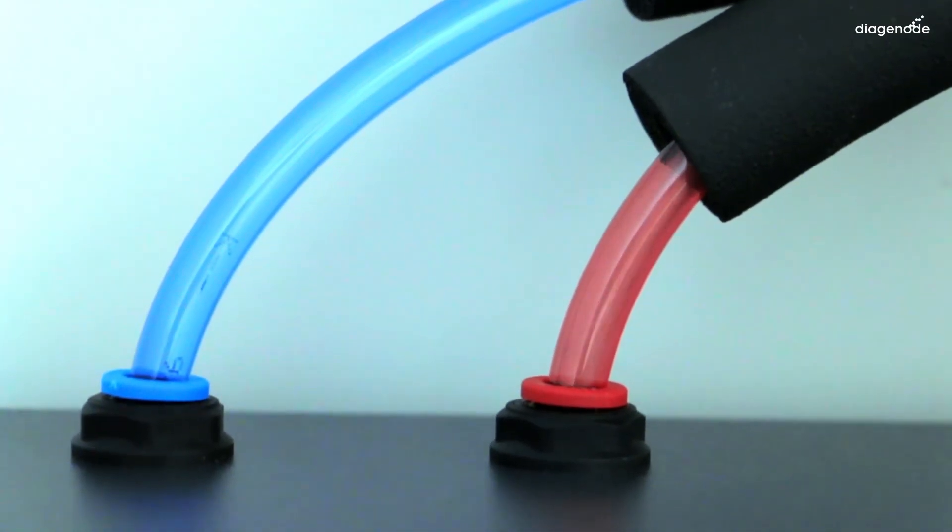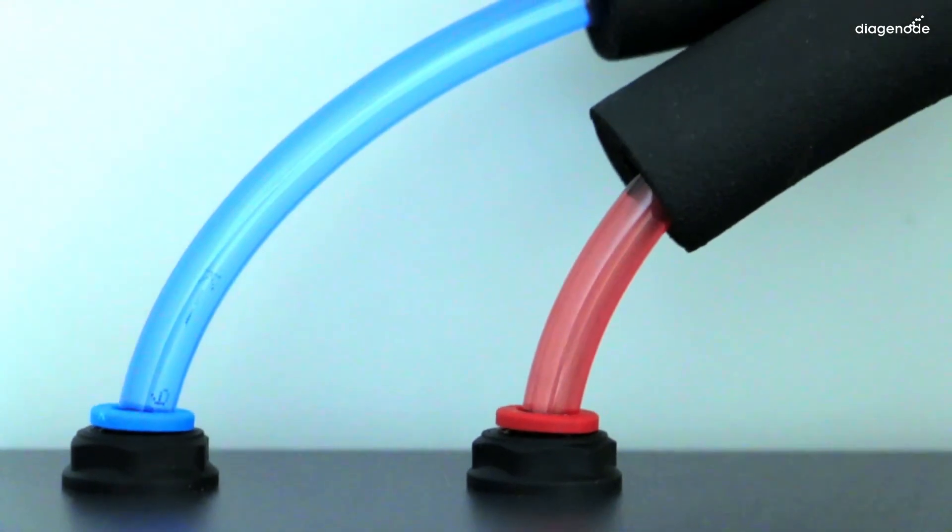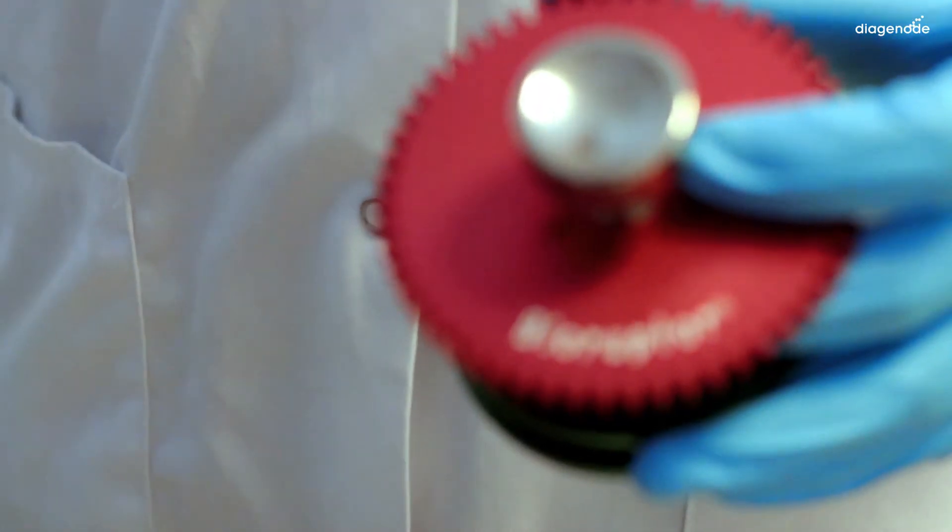You can see if the pump is working properly by checking the water arriving in the bath from the blue tubing through the motor plate. OK, you are now ready for your first test.